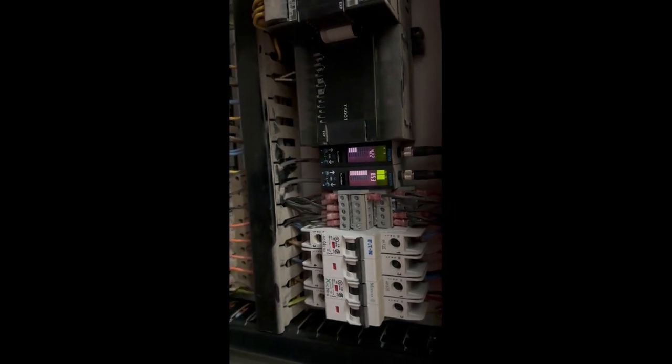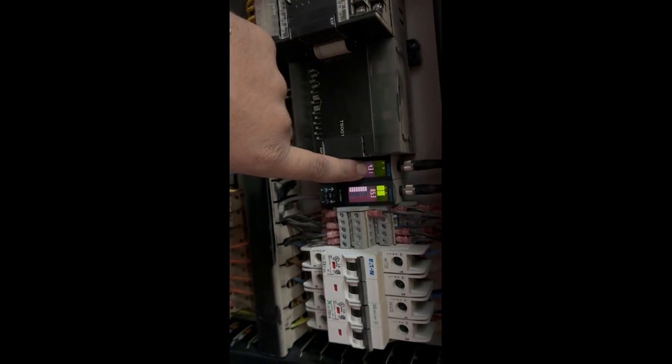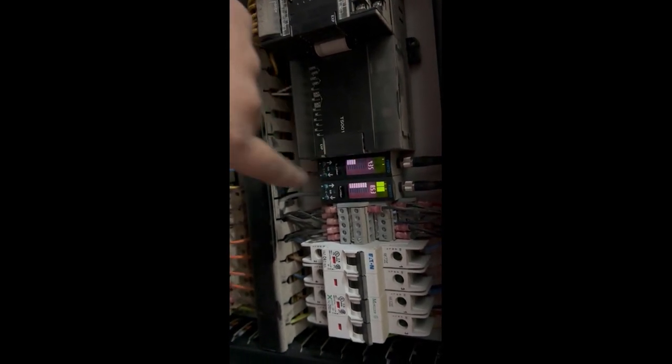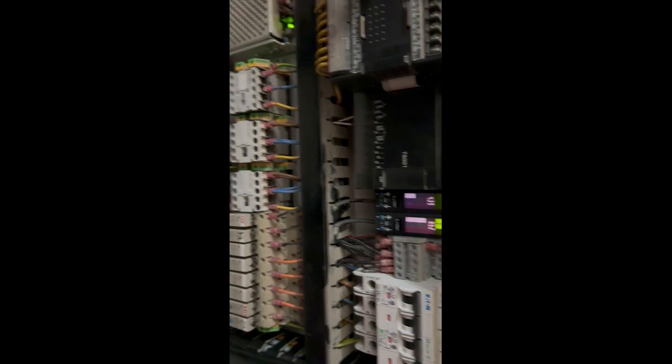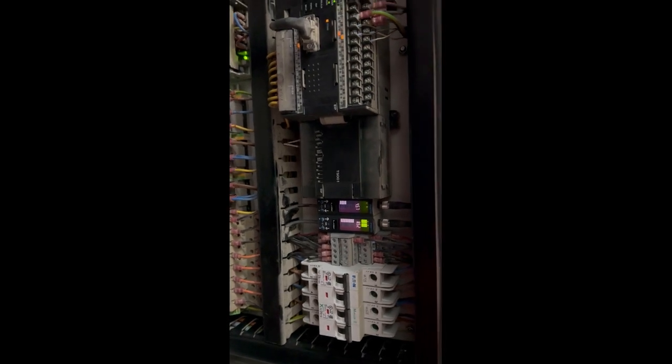Since the pressure is rising, let's see in how much time we will get this pressure. So this is compressor 1. We will do the same for compressor 2 and compressor 3, and then we will conclude the result.